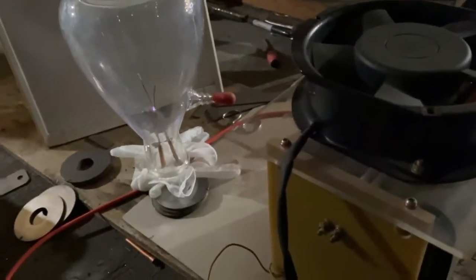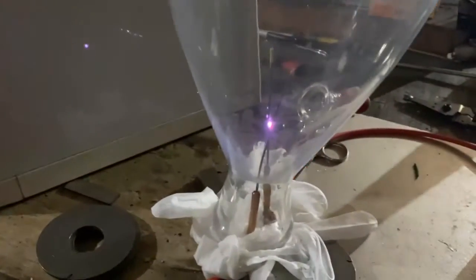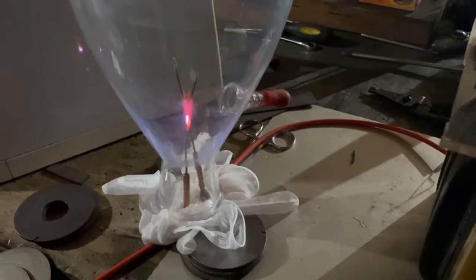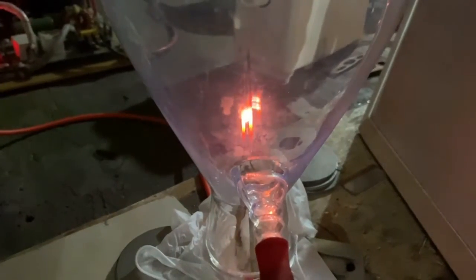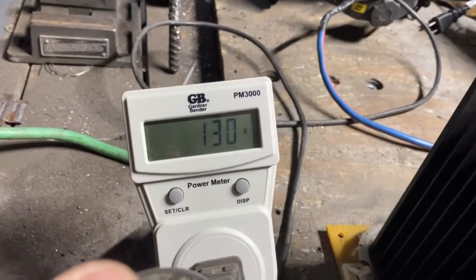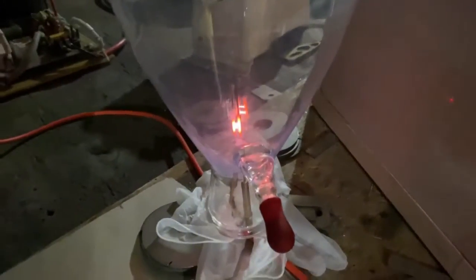I'm going to turn this up — look how freaking hot that's getting. It's getting that tungsten rod really hot, I've got to check the water. At a lousy 137 watts, and 60 of that is the fan. Why is it so hot and yet it won't do the Jacob's ladder? Isn't that weird? I guess this is going to test the high heat principle.